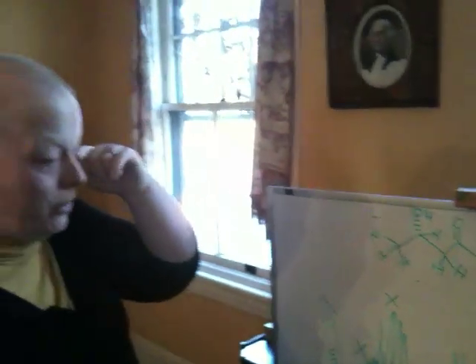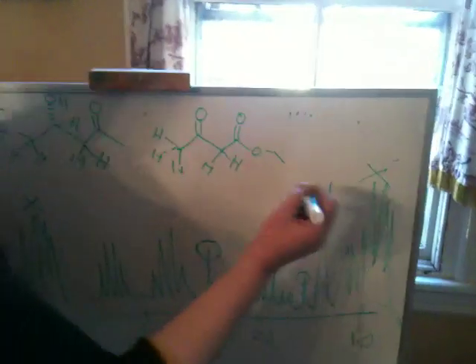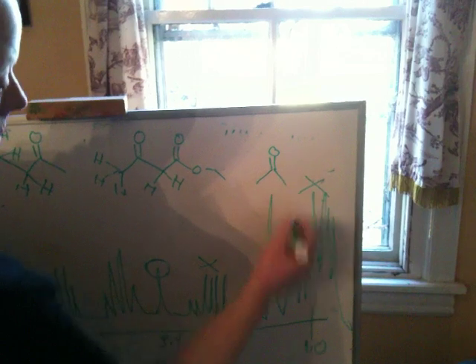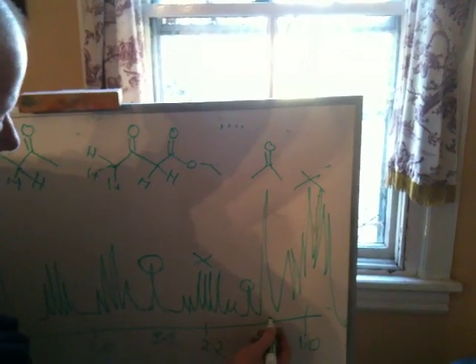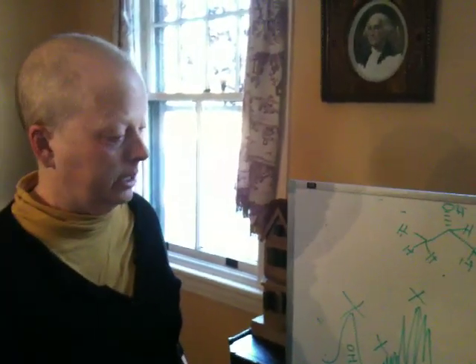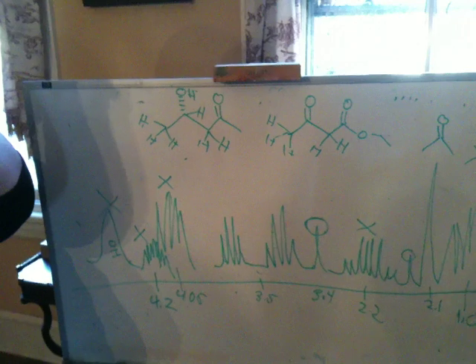I want to point out also that a lot of people have acetone in their sample, and acetone's always around 2.1 or so. Acetone is from rinsing the tubes. Now this is very messy looking. What are these other things from? I'm assuming, I haven't even looked these up yet.